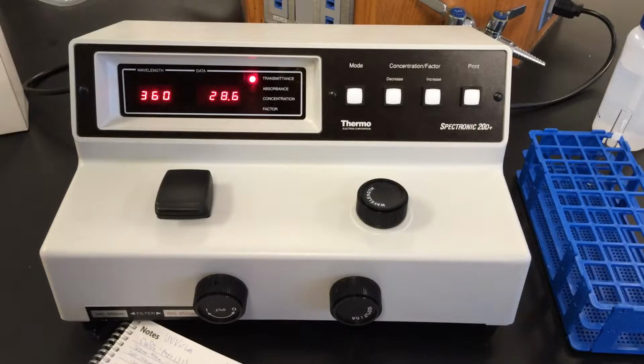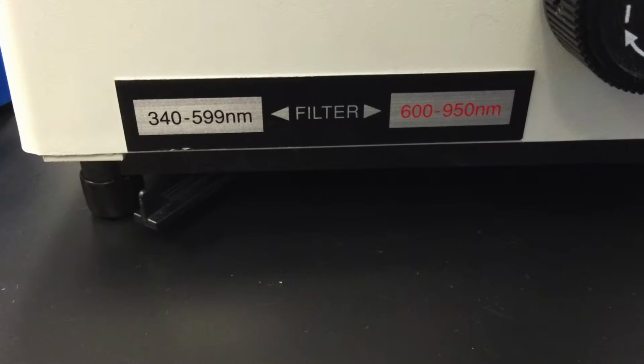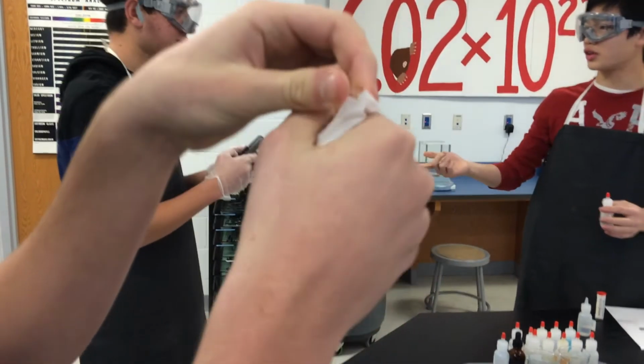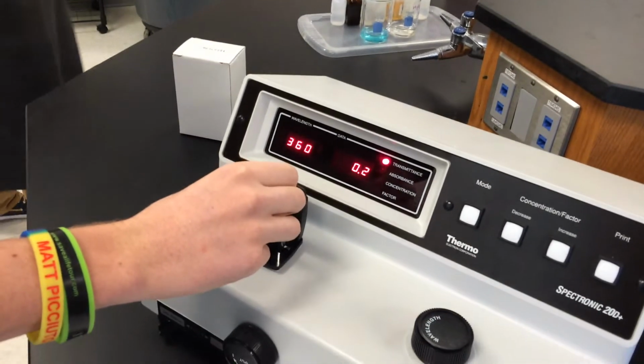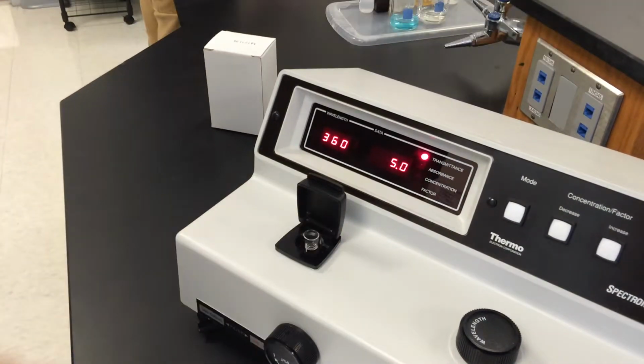The only way to do this is to test a variety of wavelengths and use the data produced to determine which is best. Set the wavelength on the spectrophotometer to 360, making sure the switch on the bottom left of the spectrophotometer is on the correct range. You then first zero the spectrophotometer by placing a cuvette filled with deionized water into it. Make sure to remove all fingerprints with a chem wipe prior to inserting the cuvette.